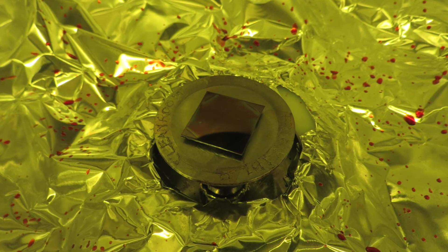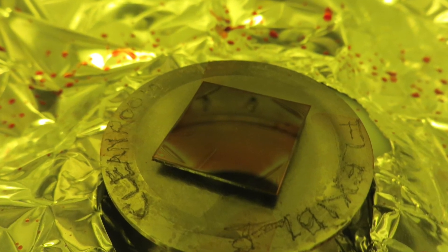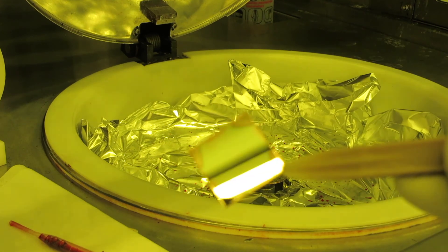I didn't do any kind of cleaning on this chip before I spun it, so you can see a few faint streaks. On a square chip like this, it's normal to have some strange looking areas in the corners due to turbulence. You generally are looking for a nice even color across the whole center area of the chip.